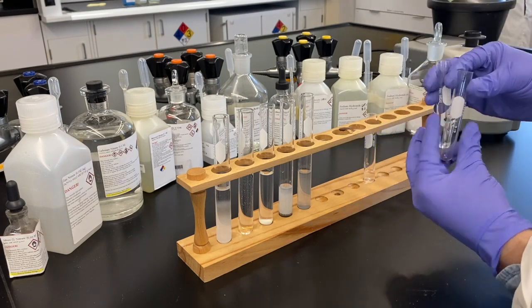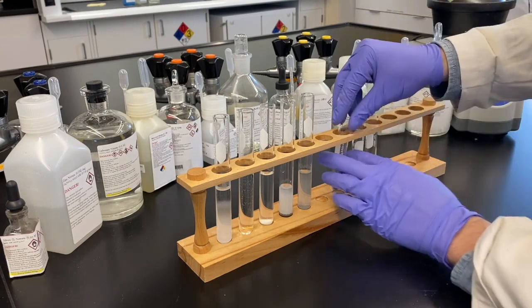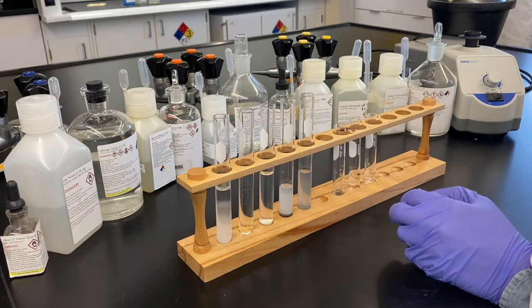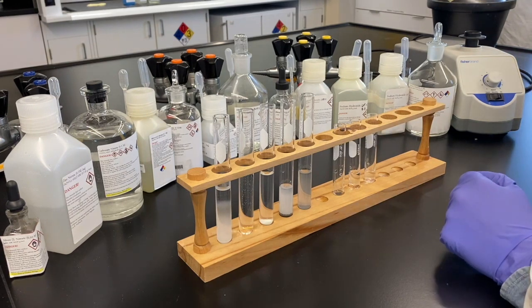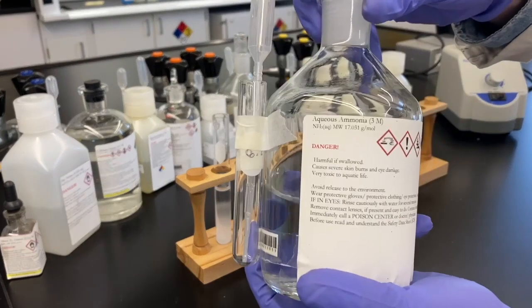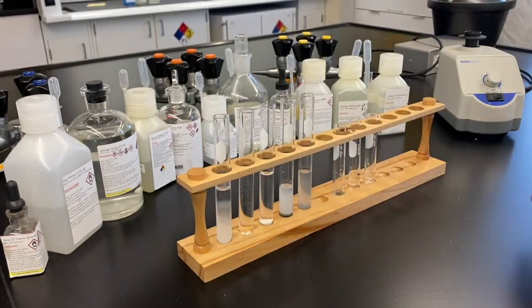All right, so we've got our mercury 1 solid there, and we're going to test for silver in the supernate. I think here I was thinking I would add ammonia, but then decided against it because there should already be sufficient ammonia in solution.